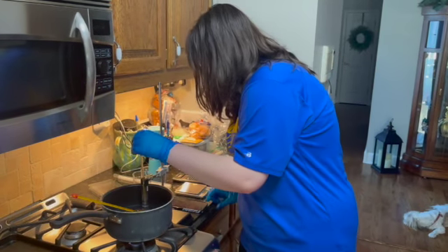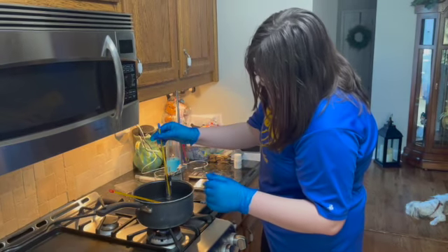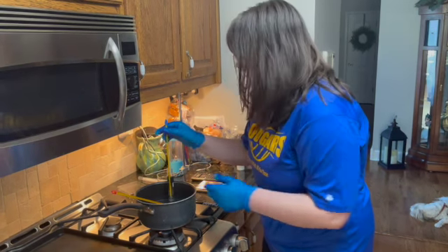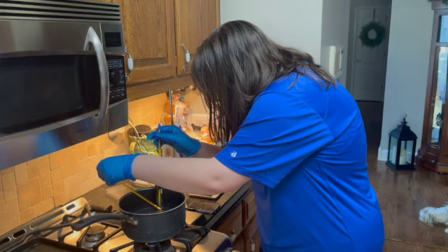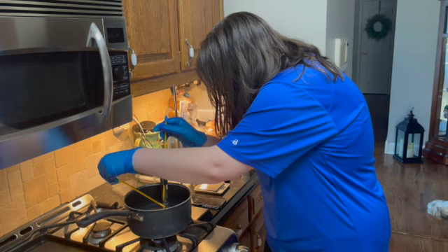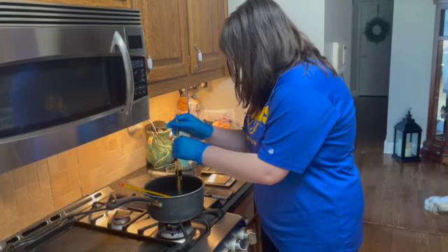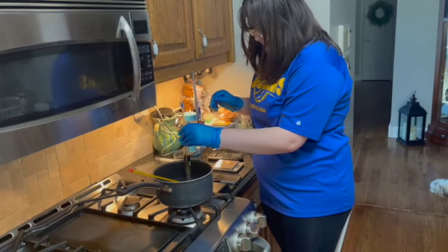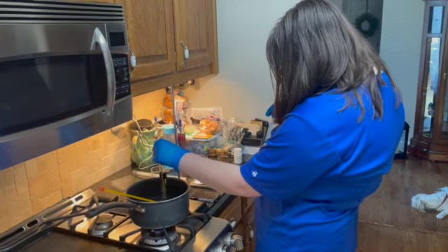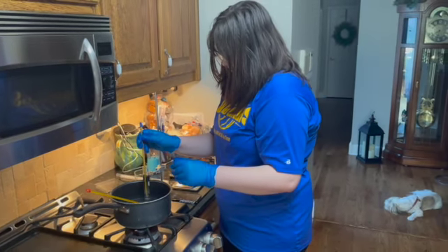I need to switch gears and turn back on my phone. Okay, so we're at 14 minutes, and our solvent is at 54 degrees Celsius, right on the dot, at least what it looks like, and our hot bath is at, I would say, a 54.5, getting pretty close to 55 degrees Celsius. But it still hasn't completely melted through, so we got to keep continuing until this is completely melted.